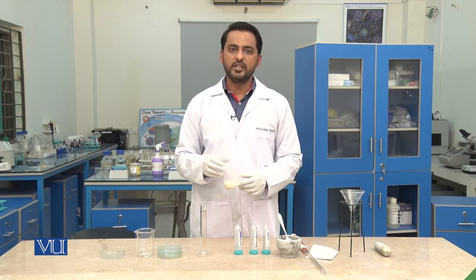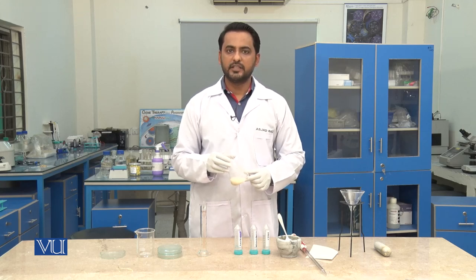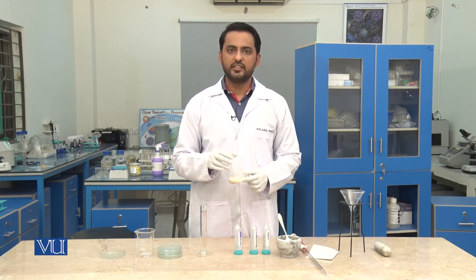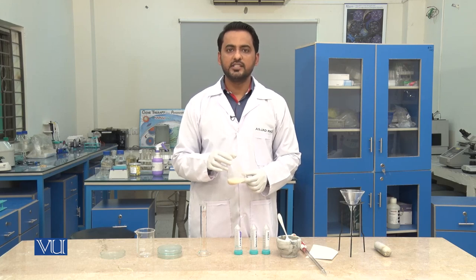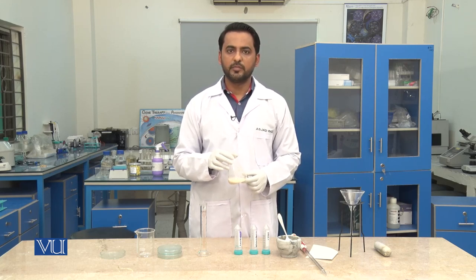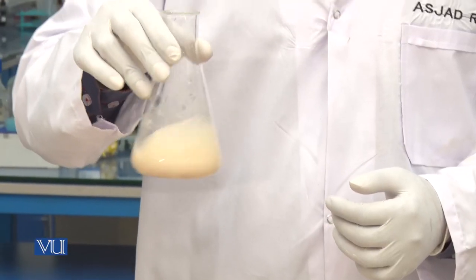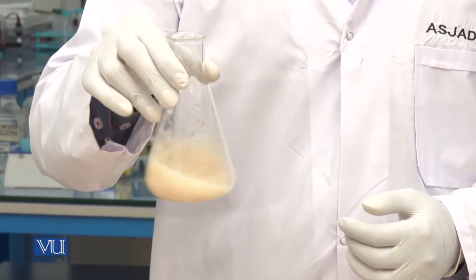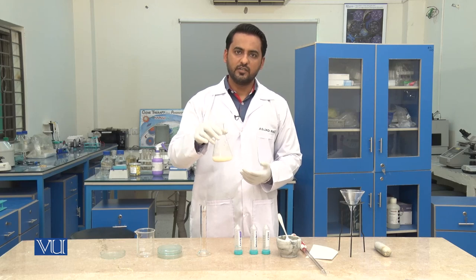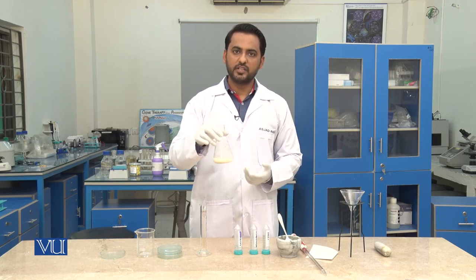So students, as we have added NaCl and methanol once again, we will shake the flask for 30 seconds and incubate it at room temperature for 30 minutes. After shaking it well, now we will put this flask for 30-minute room temperature incubation.